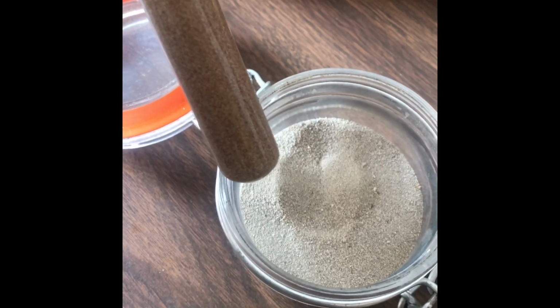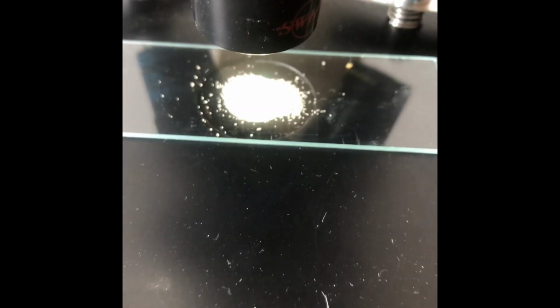It looks like it maybe both could be sand or something like that, but here we go. So there it is. And let's take a look underneath here. It might be a little bit harder to see. Let's try to get it in focus with my own eyes. There we go. That's what that looks like.